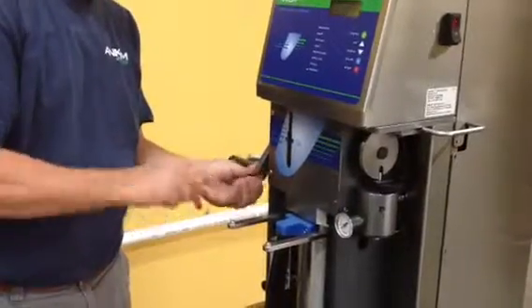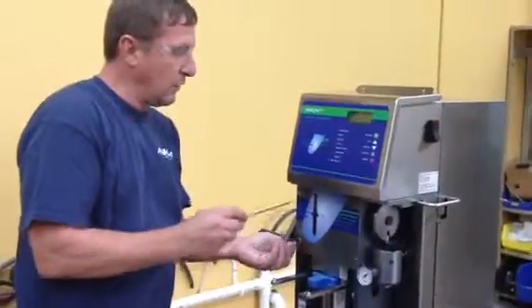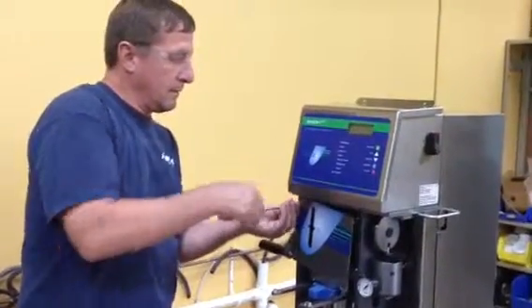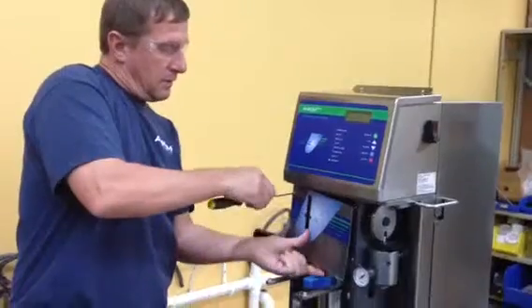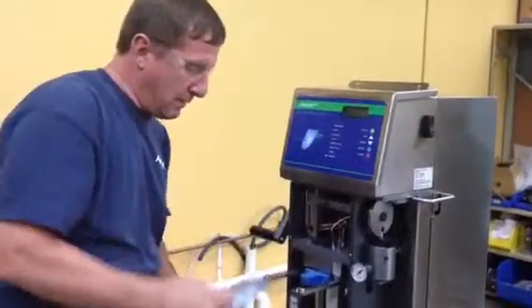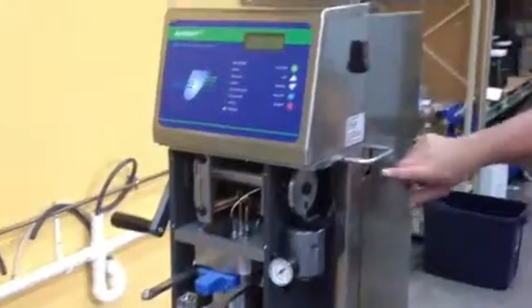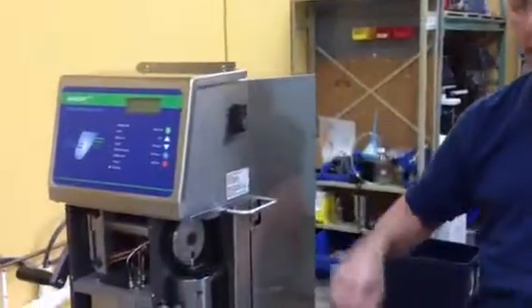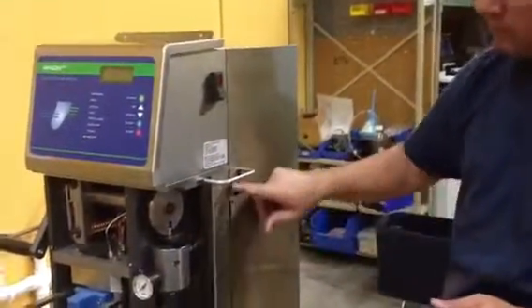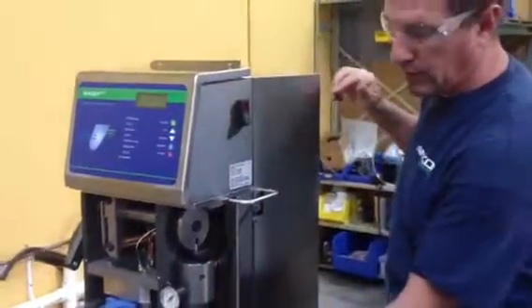What we're going to do is give you points of possible leakage during the run. Take that plate, set it aside. On the back, there's going to be 4 screws on each side. I don't have them in here right now, but you can use the same screwdriver. Take those 4 screws on each side, so there's 8 total.